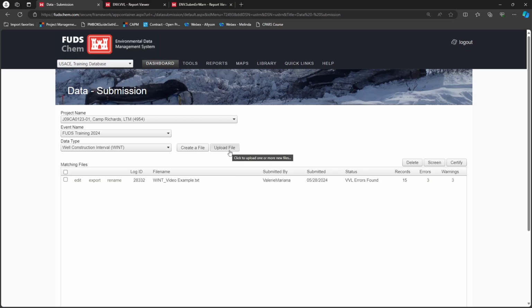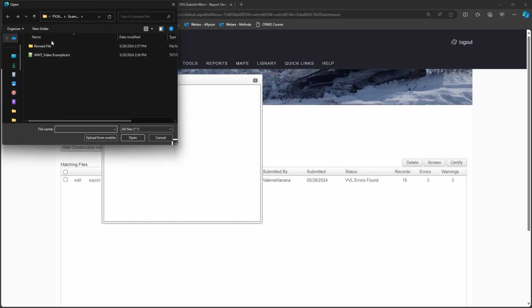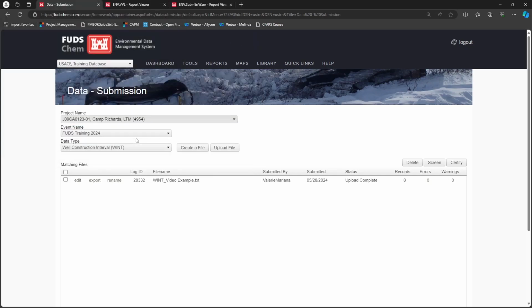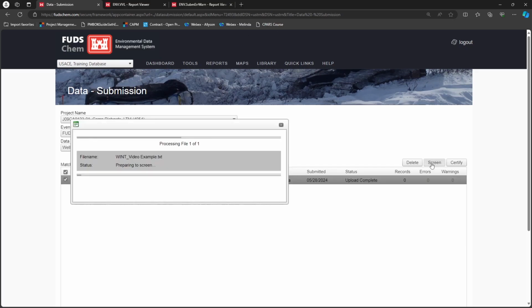As a note, if you are uploading a revised file with the same file name as before, you don't have to delete the old version. The new file will overwrite the old one. Once your file is updated, click Screen to run the screening checks again and confirm that the error resolves.